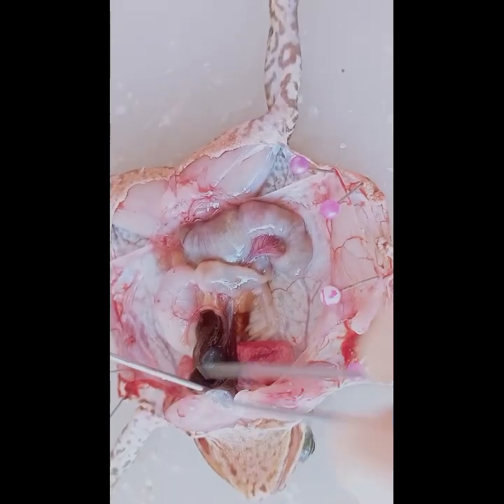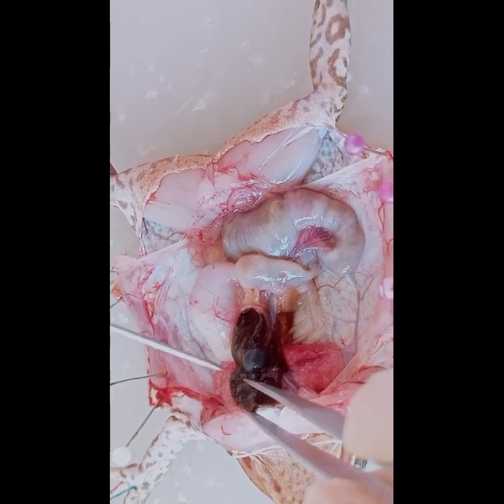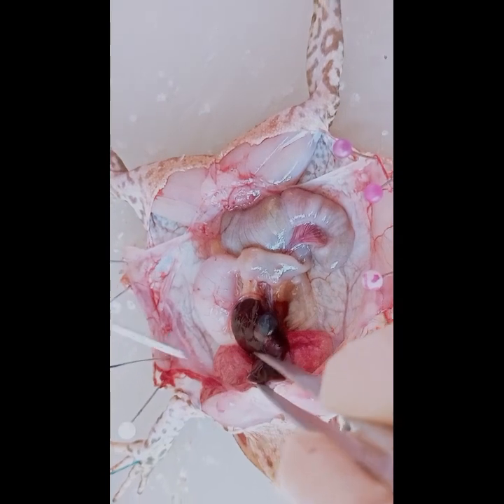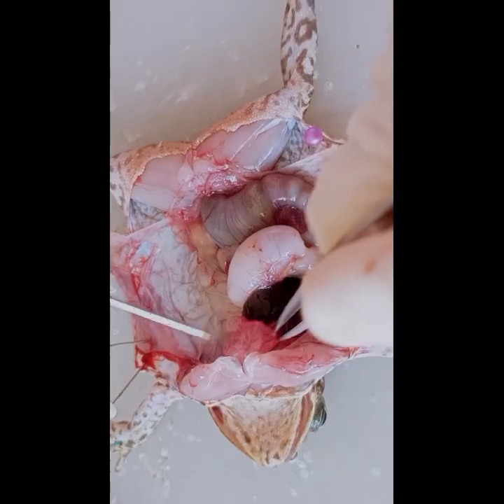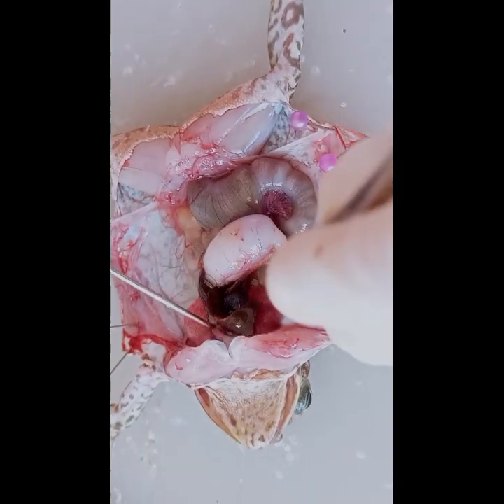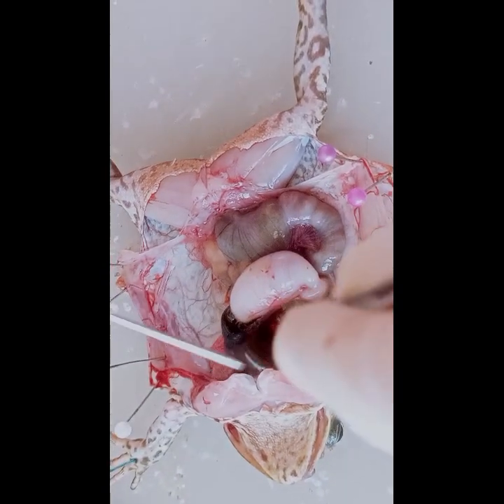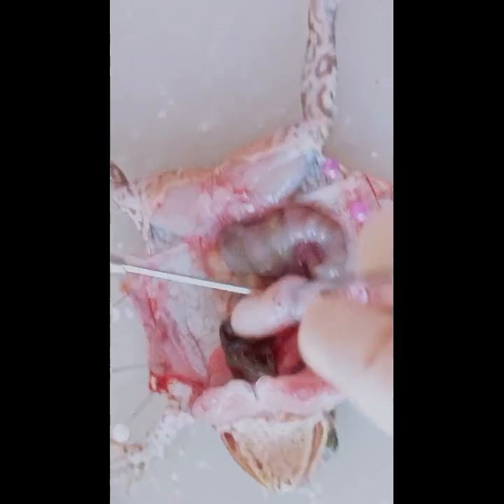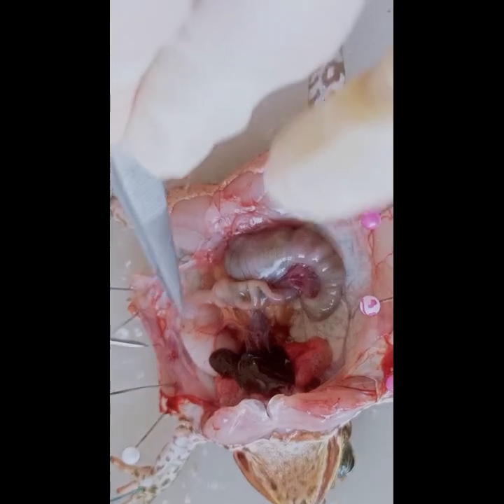Now we'll locate the greenish sac attached to the liver underneath. This is the gallbladder. It stores bile before it passes to the small intestine. And then we will locate the lungs, on either side of the heart. They are two reddish brown sac-like structures. So those are the lungs.